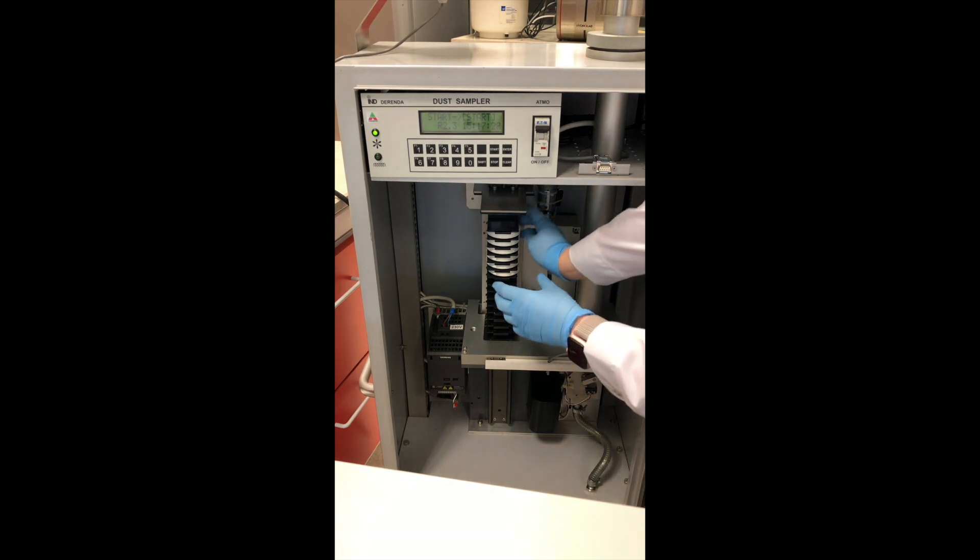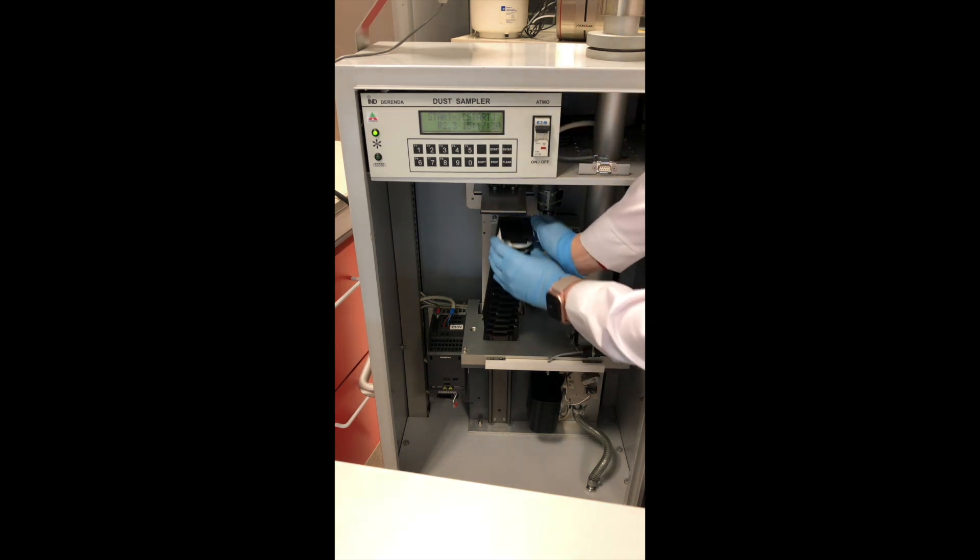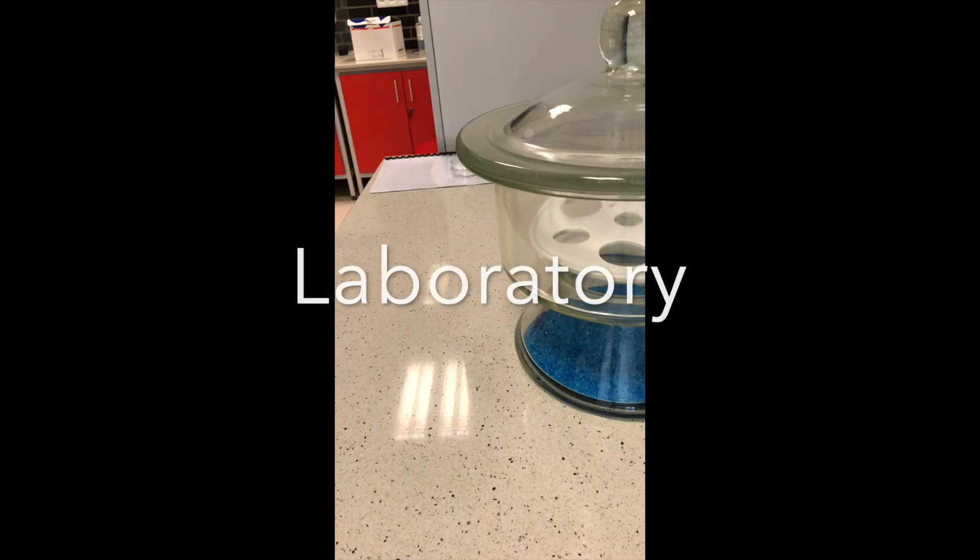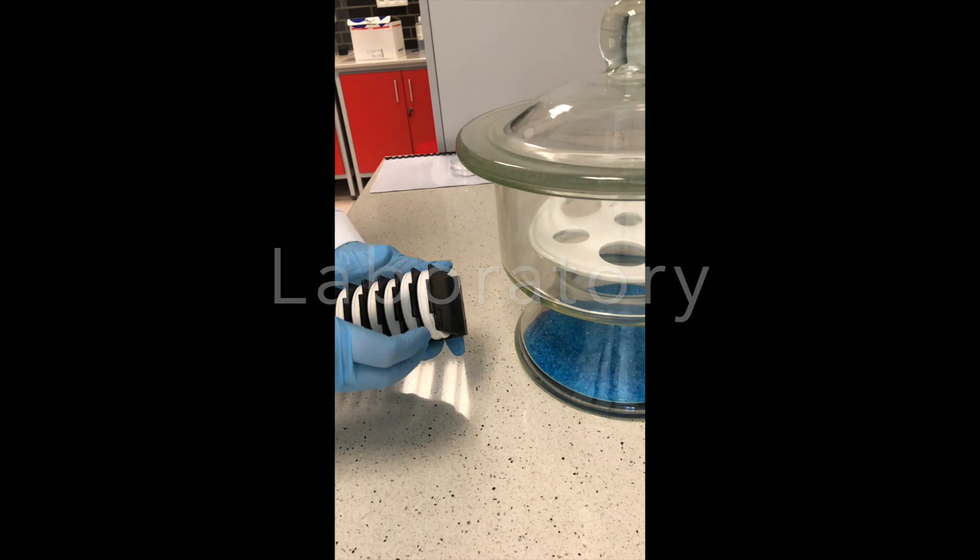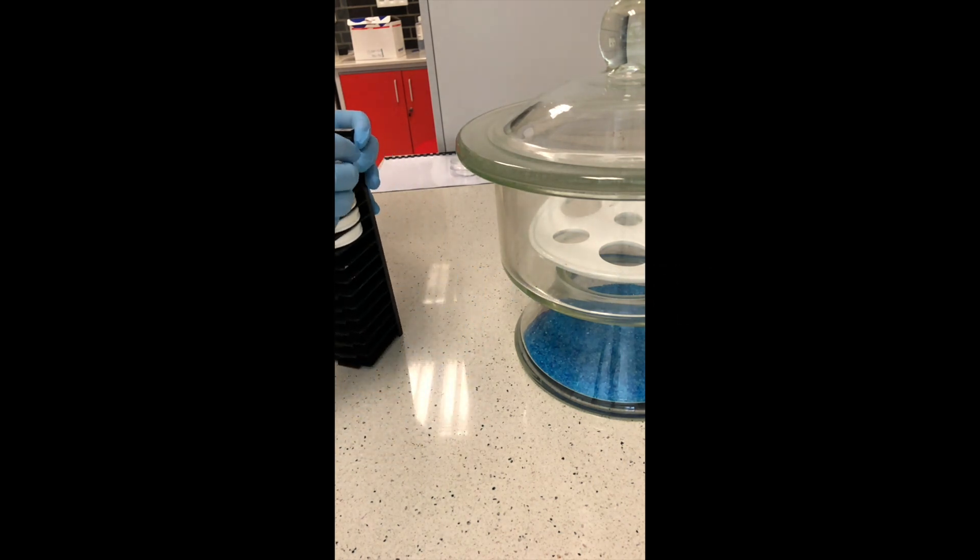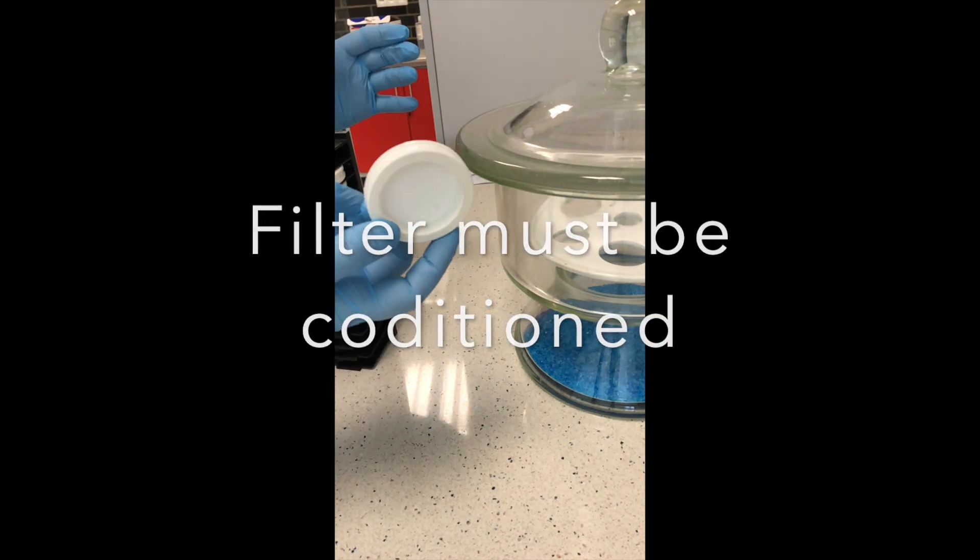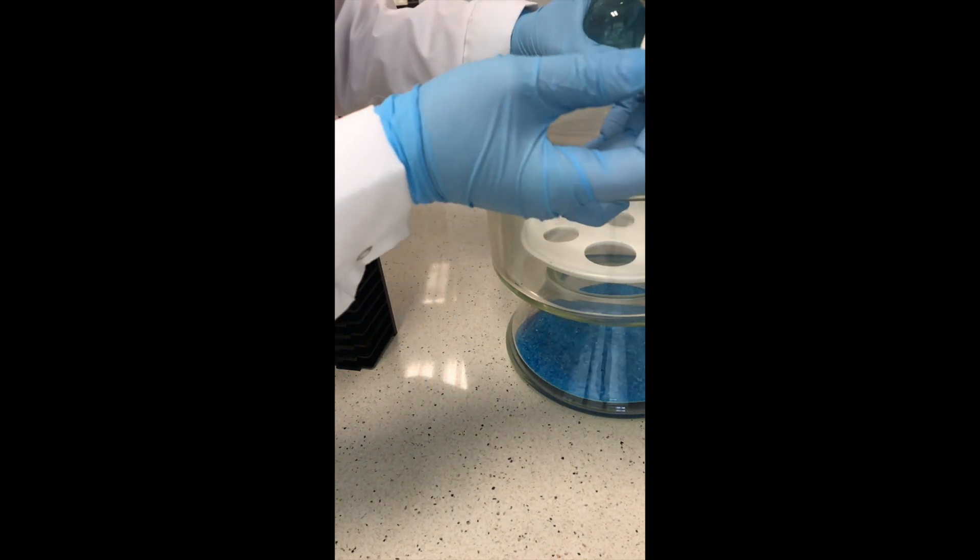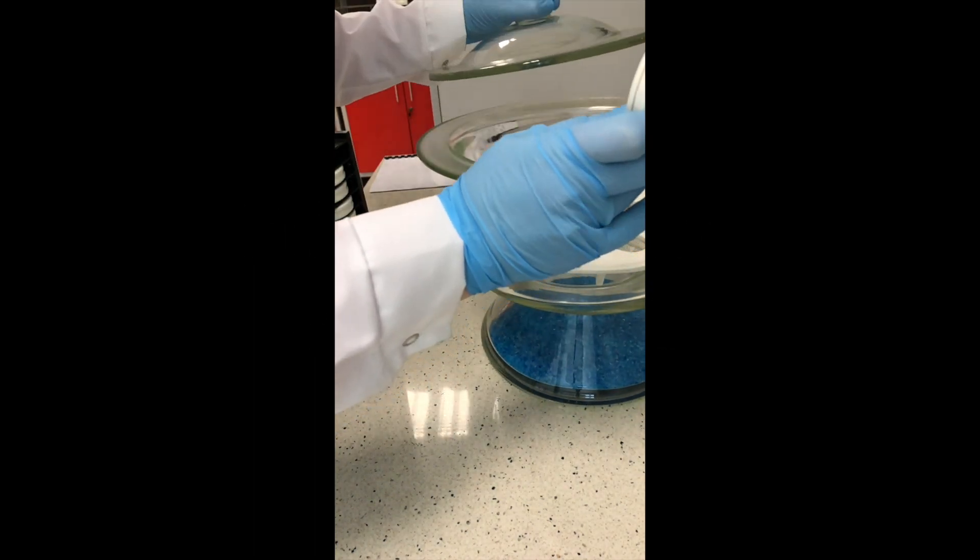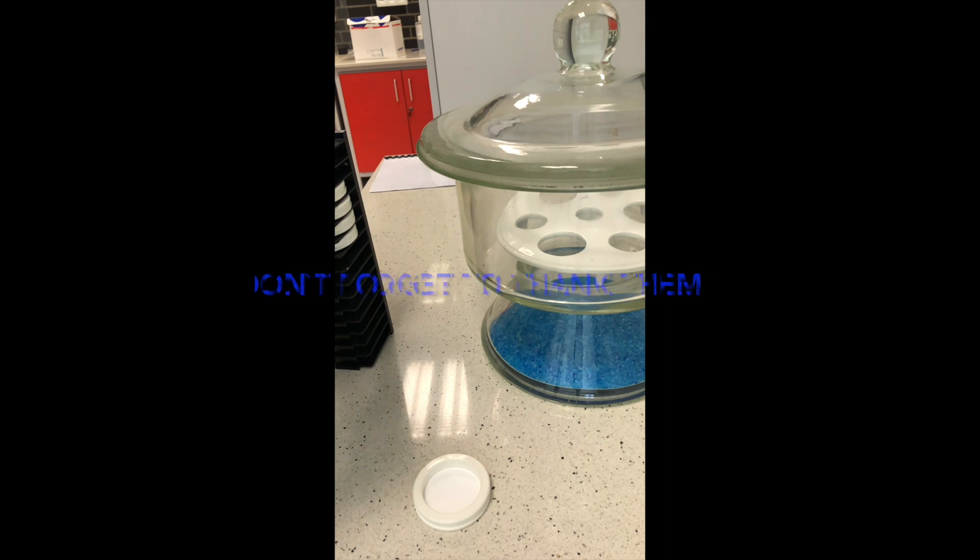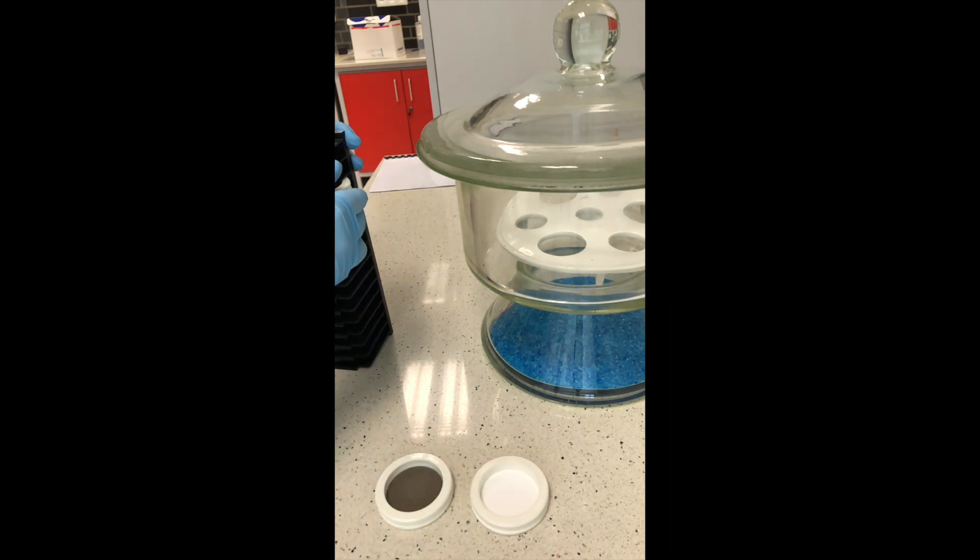Next you take the cassette and take it to the laboratory. The important thing is that when you have this cassette in the laboratory you cannot weigh the filter just when you came to laboratory. They have to be conditioned. After two minutes the filter is still clear, but I have put some filters after they were exposed by your colleagues last years. After 24 hours they look like this.